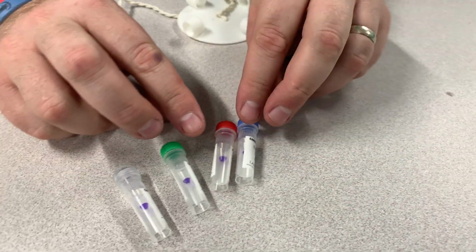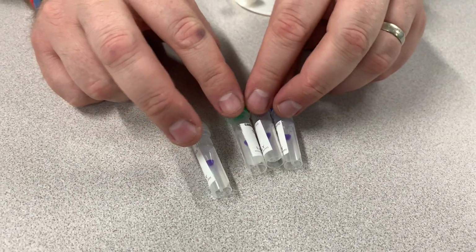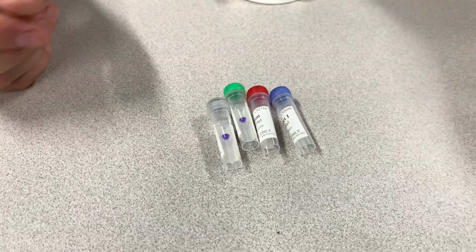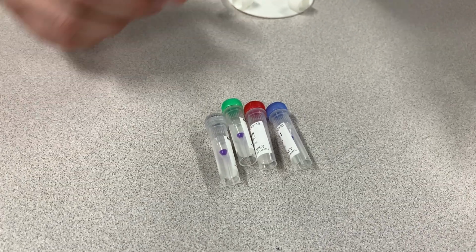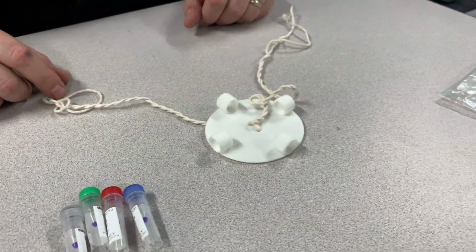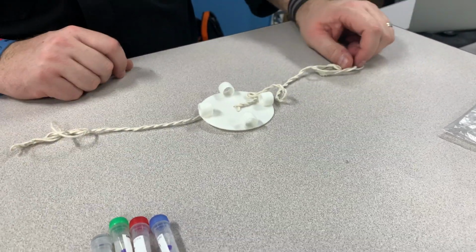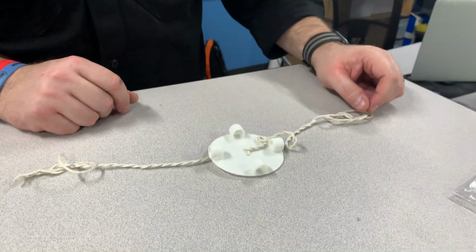All right, so all 4 are easy to load with your pipette tips, so that you can then put them into the well. All right, this is going to be available. I'll make sure that you can get it so you can print it. And this is just some string. You run it through, and then you saw how it works. Cool.